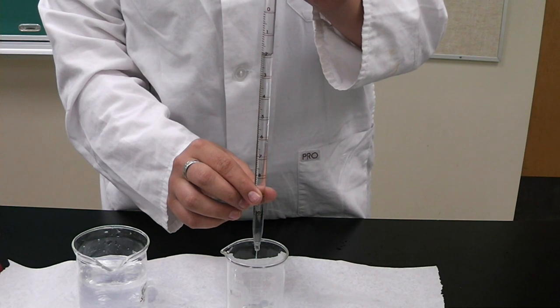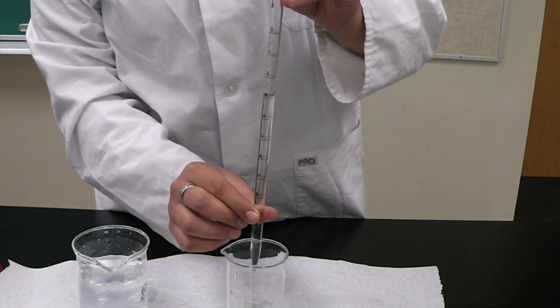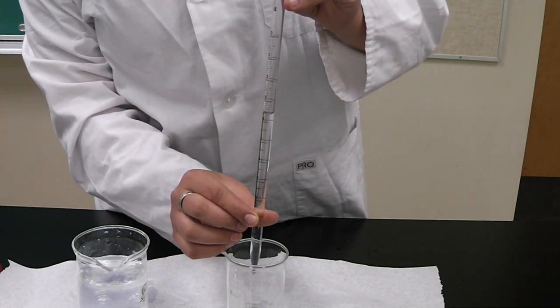When dispensing the liquid into your target beaker, make sure that you do it carefully and slowly, as you do not want to overshoot your mark.